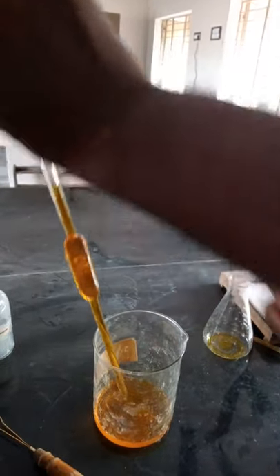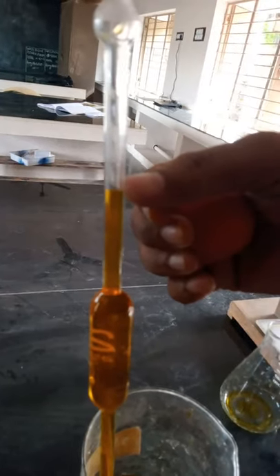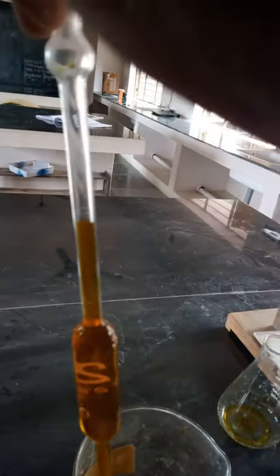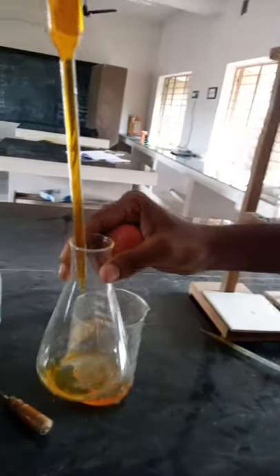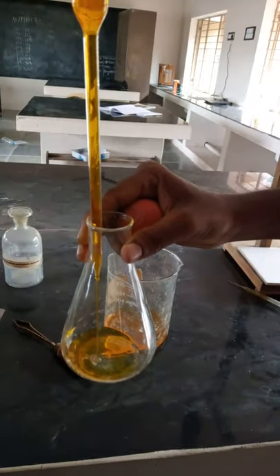Take the solution up to the 20 ml mark, then pour this 20 ml into the conical flask.